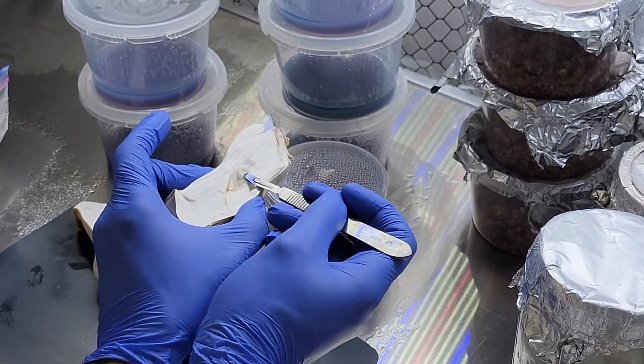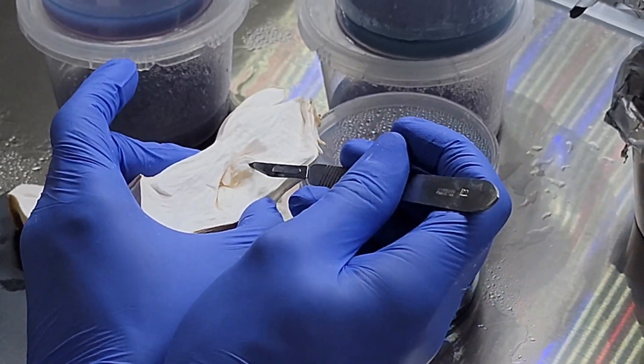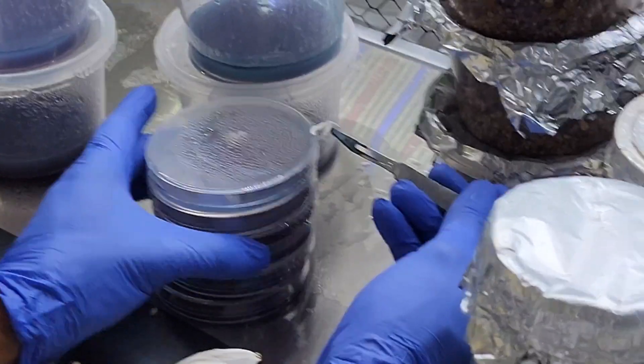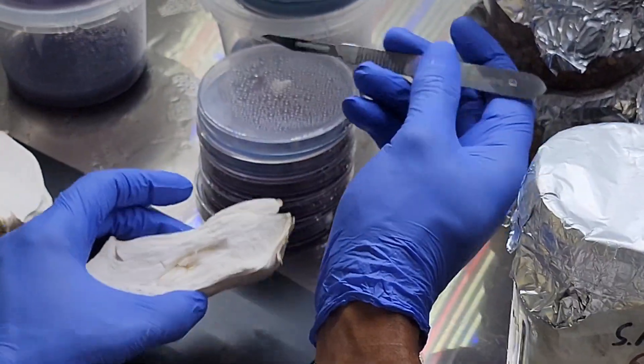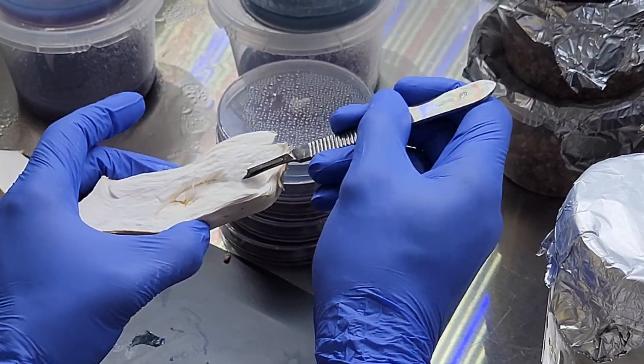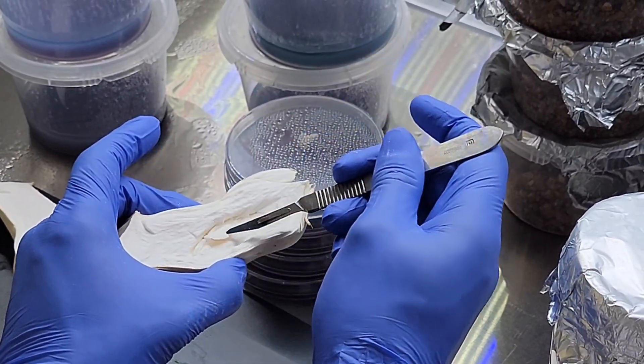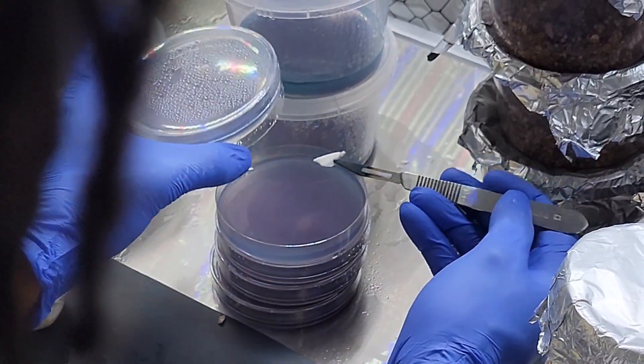You really don't want to move on to the next step until you know that your specimen is completely clean. Otherwise the mycelium will lose the colonization battle, and in the long run that means you'll be wasting resources because they'll be contaminated. So best to be patient and make sure that specimen is very clean.